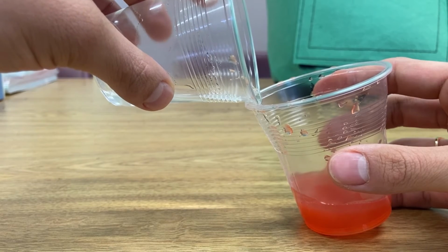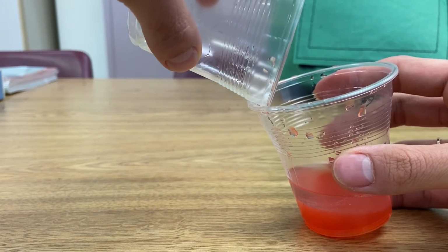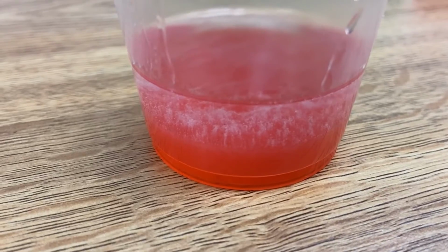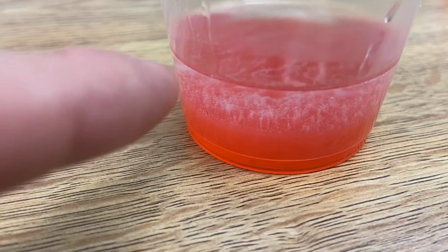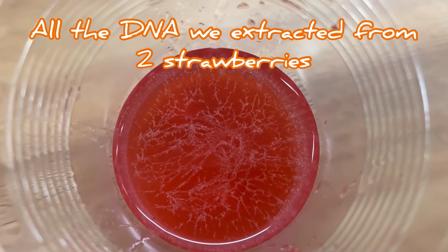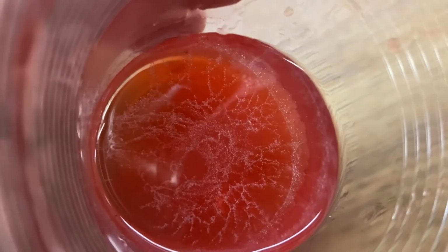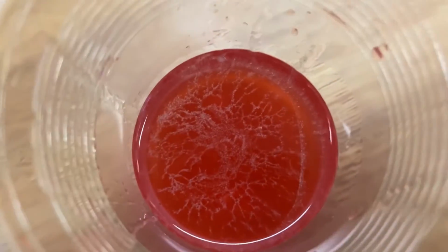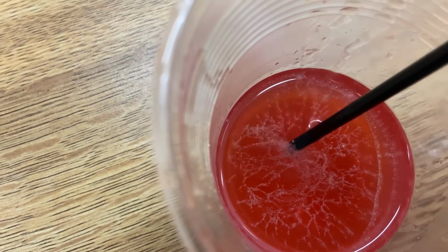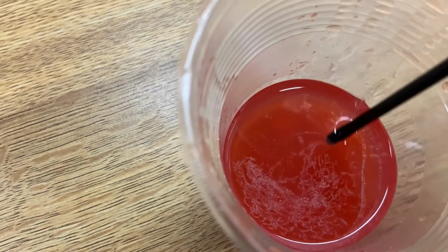Because right now we have just isolated the DNA. And look, y'all, you see that cloudy substance? That is all the DNA we were able to extract from just 2 strawberries. Isn't that so cool? And I did it on my first try. I was surprised. I thought I had to do it over and over again. Here, I'm gonna take my stirrer. Yeah, look at all that DNA. Crazy.